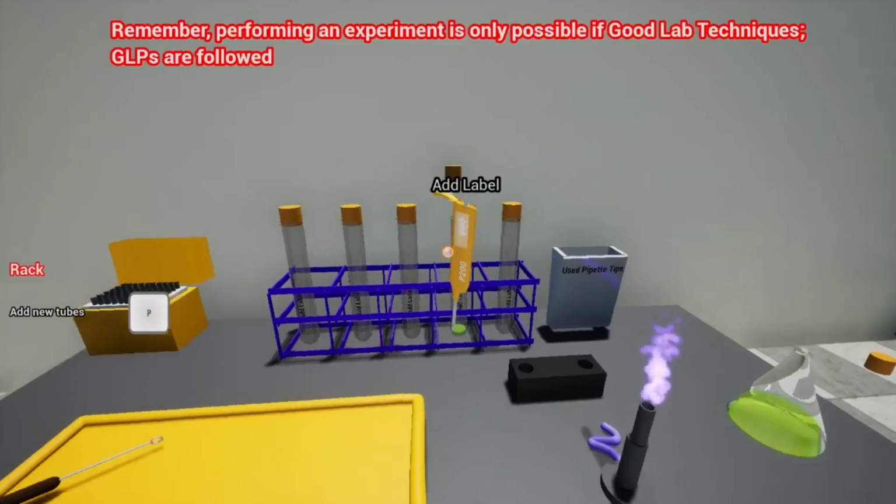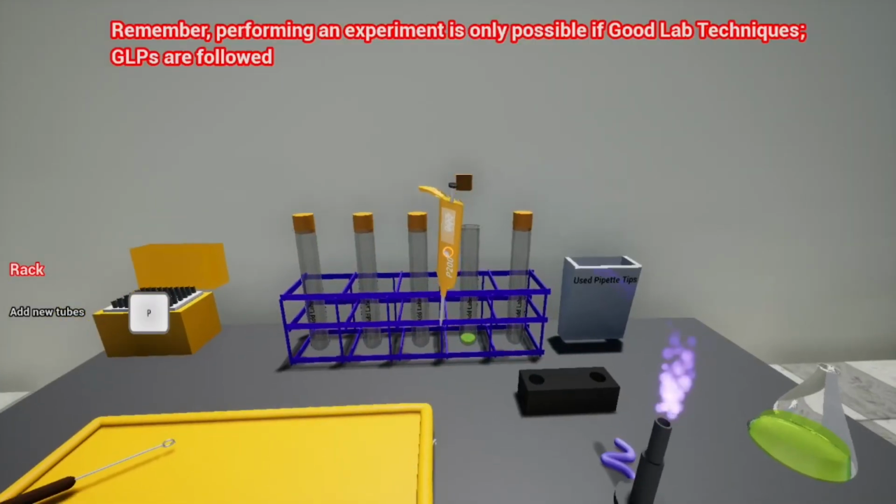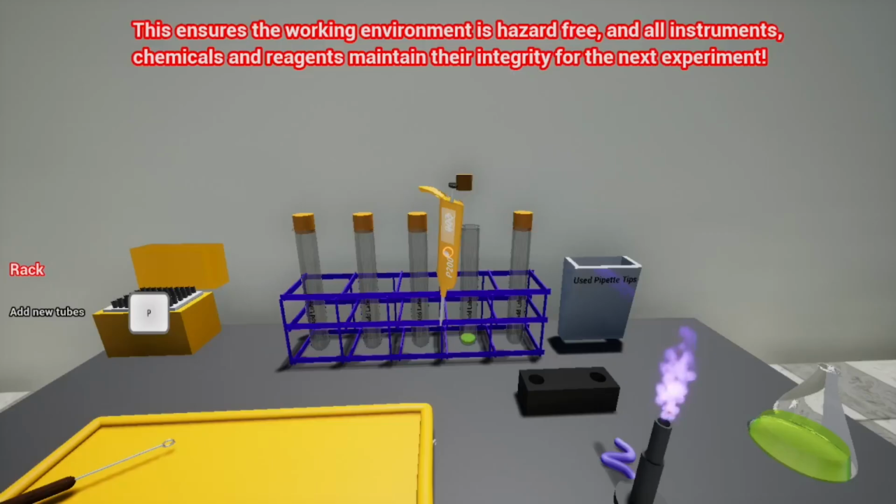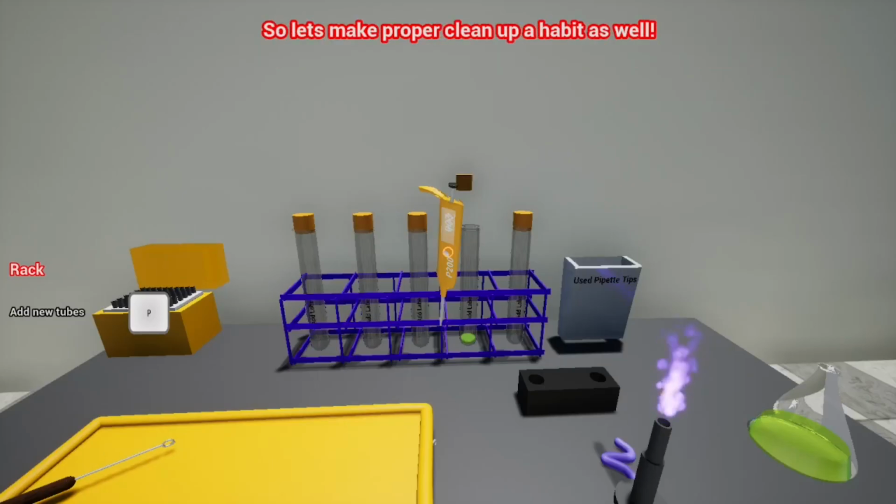Remember, performing an experiment is only possible if good lab techniques, GLPs, are followed. Proper cleanup is an important part of GLP and is equally important as the experiment itself. This ensures the working environment is hazard-free and all instruments, chemicals, and reagents maintain their integrity for the next experiment. So let's make proper cleanup a habit as well. Let's start cleanup for this lab.